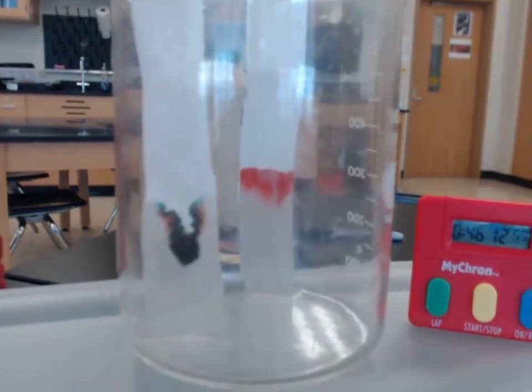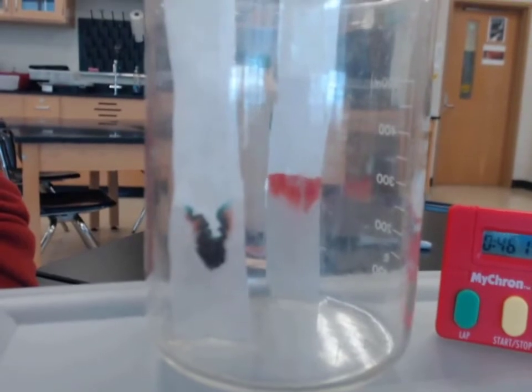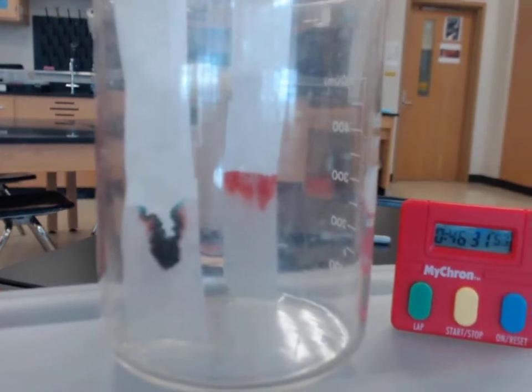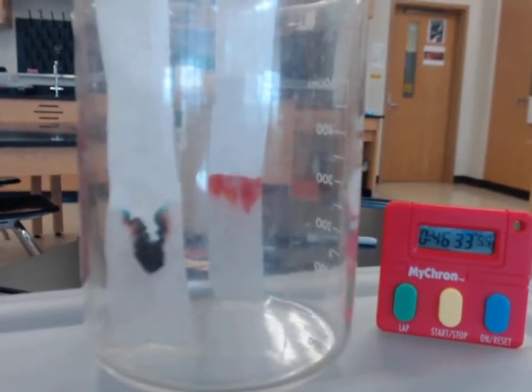Okay, we're going to bring our observations to a close. We can see big differences in the shape change that can be discussed in our observations. The amount of ink that seems to be left over is different for both of them. The colors present from the black ink that's undergone this chromatography, those colors are definitely different than what we see from just the pure red ink on one side.